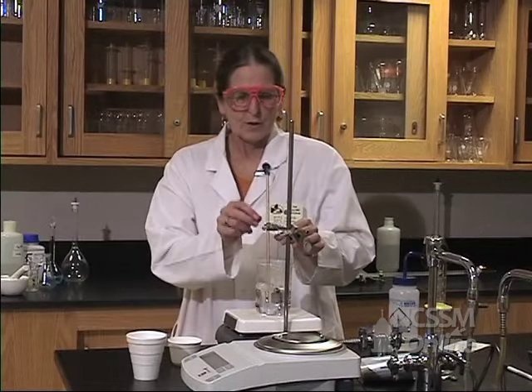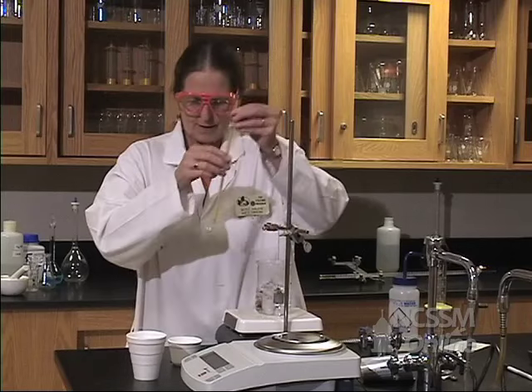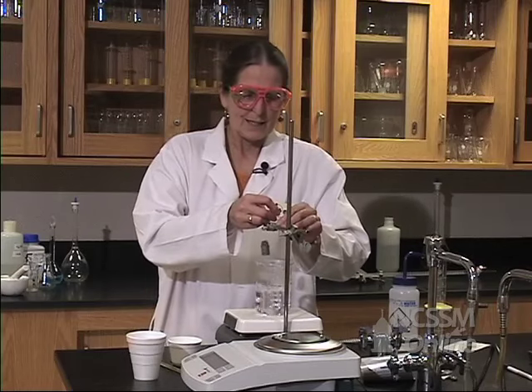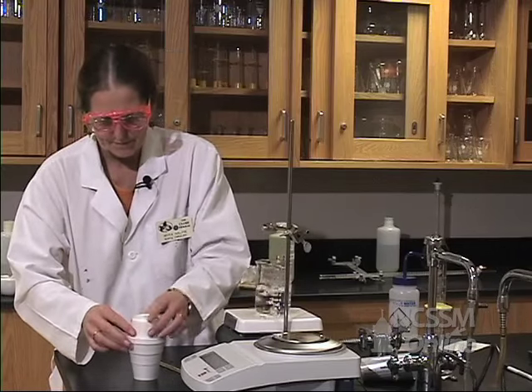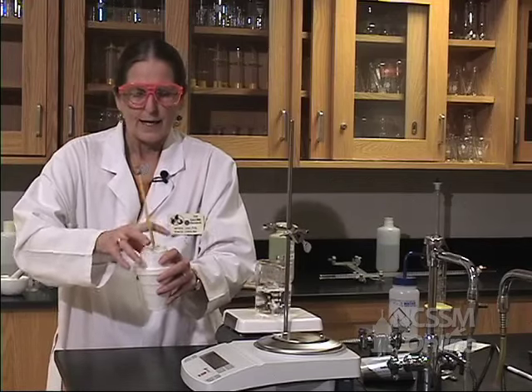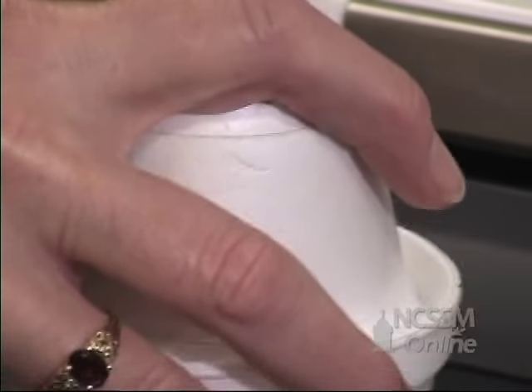I'm going to take out my thermometer, take my sample, and quickly put it in the water. Put the top on and swirl it around. We're going to swirl the cadmium metal in the water with the thermometer to make sure we get a uniform temperature.